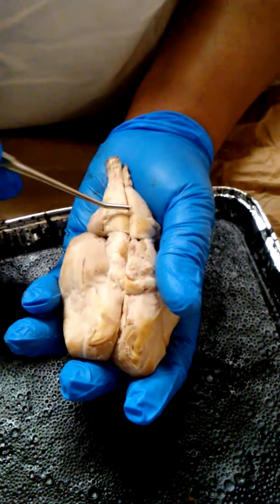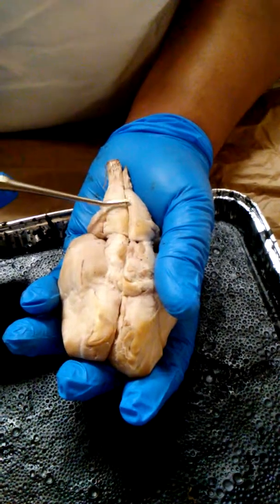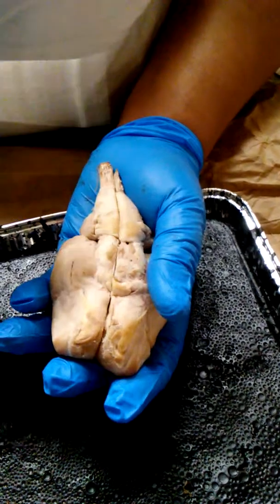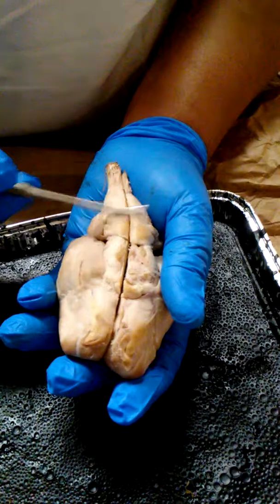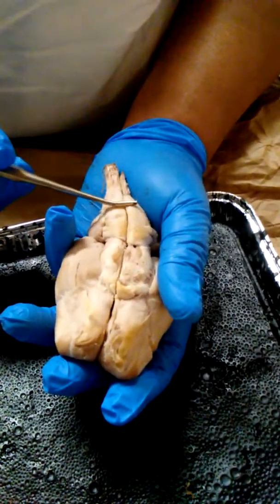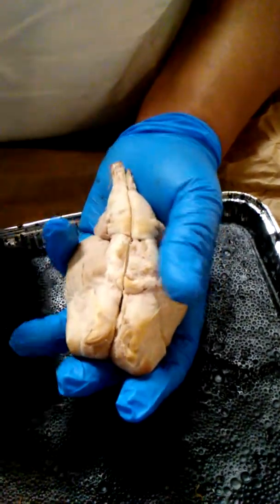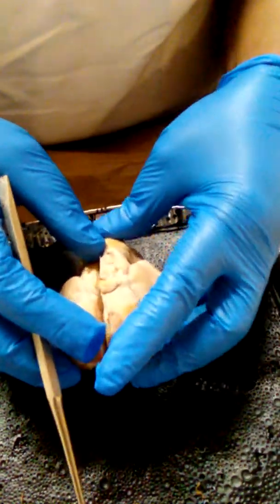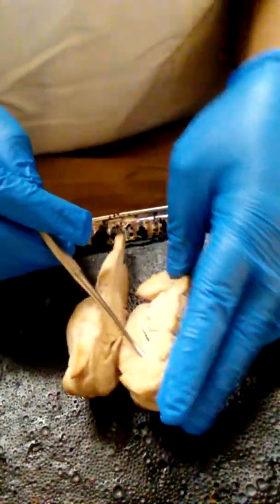And then after the pons, we have the medulla oblongata, which is our reflex center. It has to do with coughing, sneezing, vomiting, and also with our respiration, blood pressure, and heart rate. And then after the medulla oblongata, I have the spinal cord right here. So I'm going to turn the brain over to the midsagittal portion of the brain.